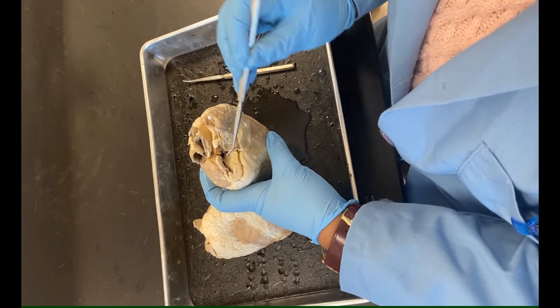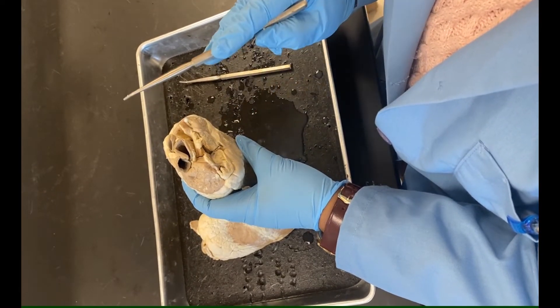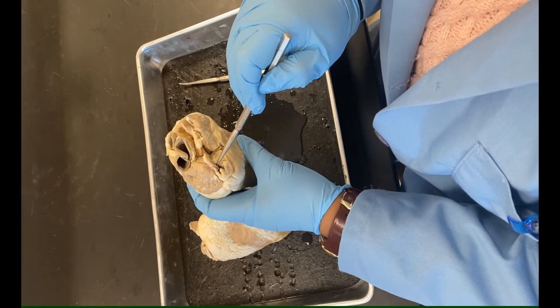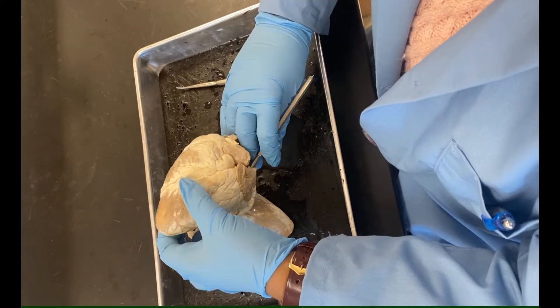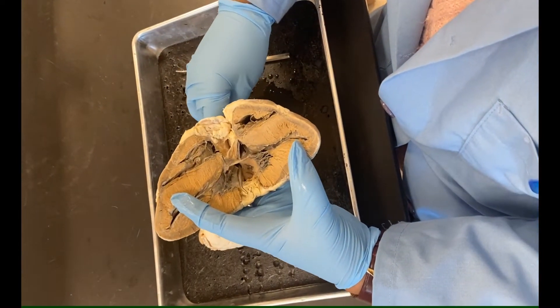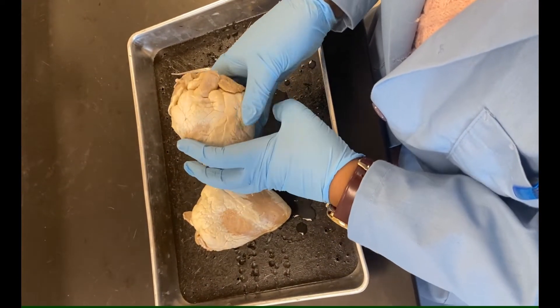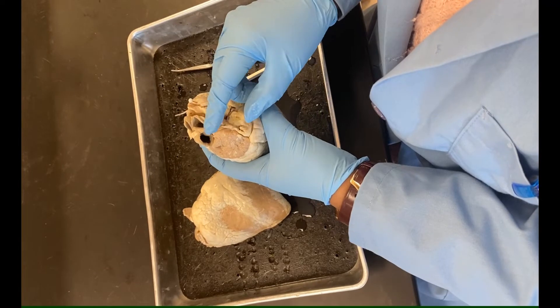On the other side, this is the pulmonary vein, bringing blood back from the lungs to the left atrium. The posterior view is much clearer. Here is the pulmonary vein — following the probe, it goes distinctly to the left atrium. So we have now covered four blood vessels around the heart, pinning the last one among the four major ones.